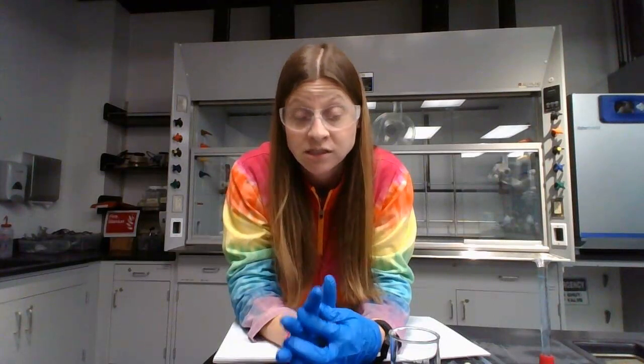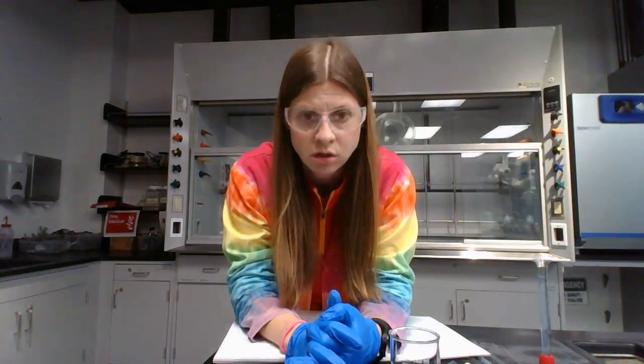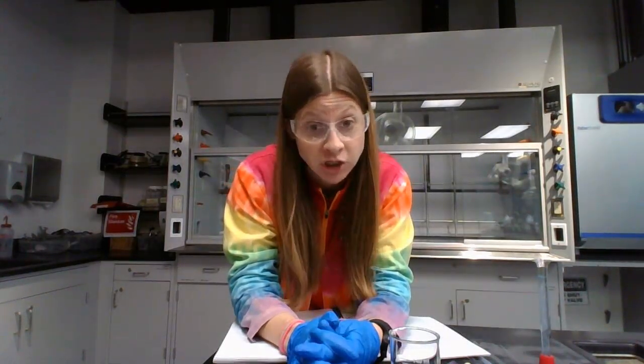The theory and calculations video goes in more detail about how the nuclear magnetic resonance, or NMR, instrument works. But what we're going to be doing in lab is, in part A, making standard solutions of known concentration of sodium in the unit mass percent. That'll be shared between you and your partner and another group. And then in part B, determining the density and testing the amount of sodium in a food item. So it'll probably be Pedialyte or chicken broth.